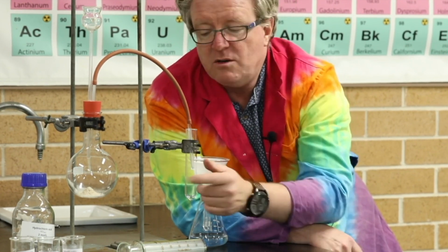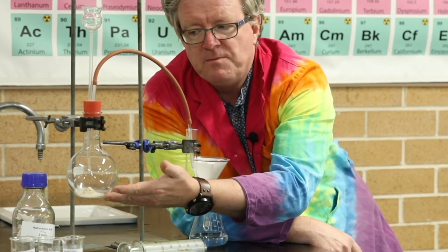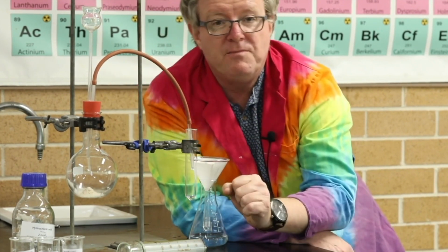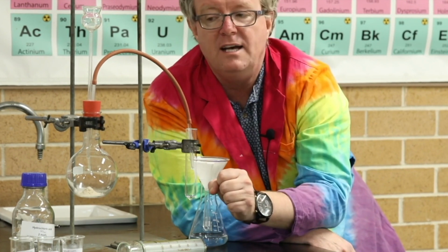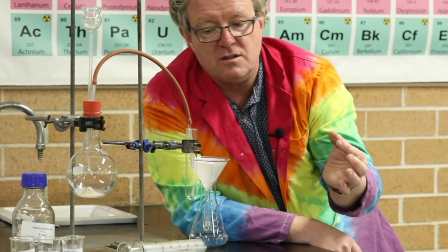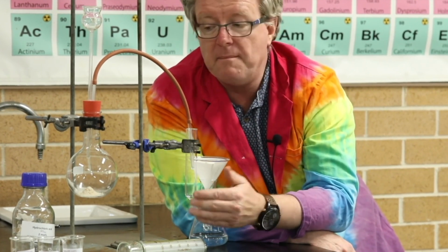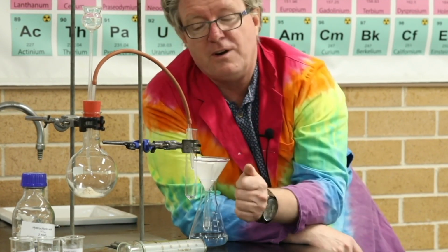But what I've done here is I've got a variety of carbonates. I've got a flat bottom flask, and into that I've got a rubber bung with a thistle funnel. Now the thistle funnel allows us to add acid to the reaction and not lose any gas. In junior years, you probably just added the carbonate and then added the acid and quickly put the rubber bung on top, and that may have resulted in a lot of gas being lost. Well, we're going to be using a thistle funnel here.